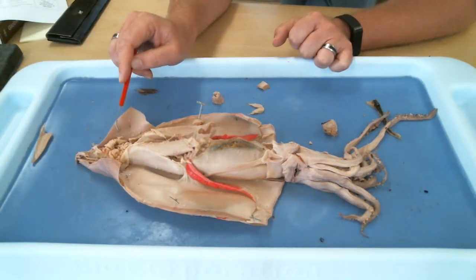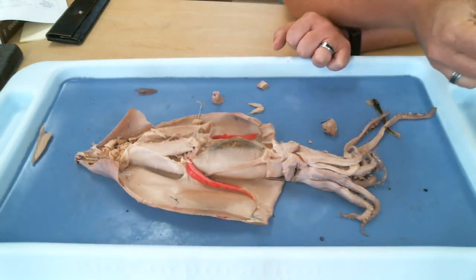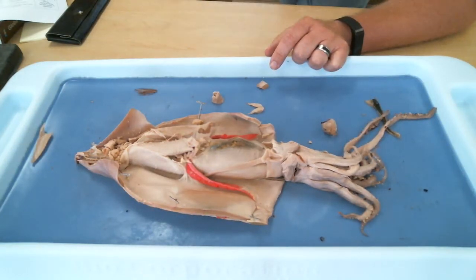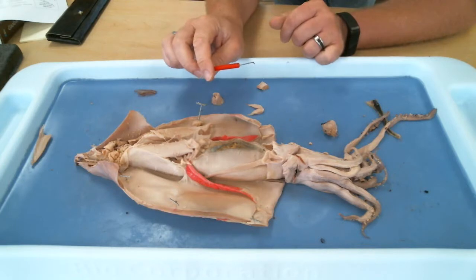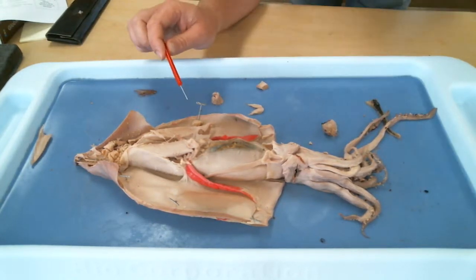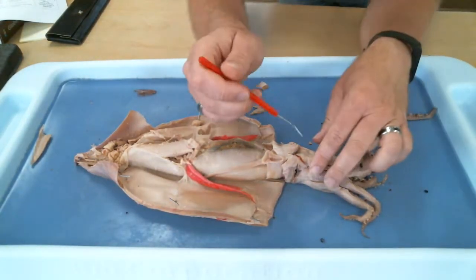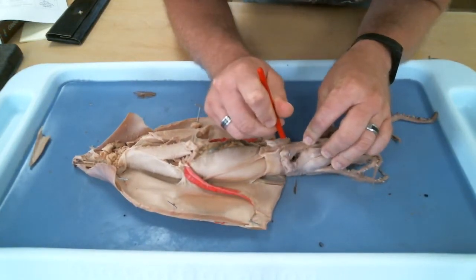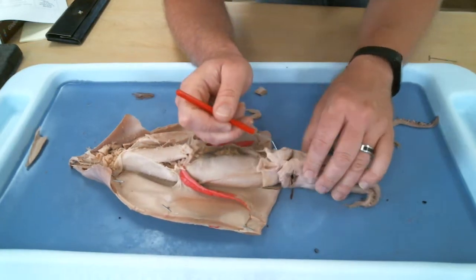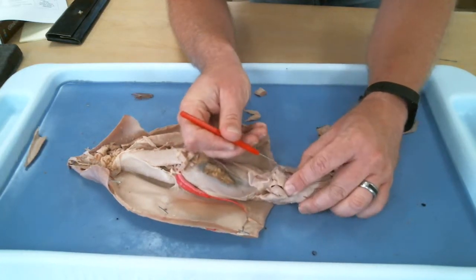They can use their fins to swim in a head first direction, but frequently you will see squid backing up into their world. If you've ever seen them swimming around, they can swim head first, but most of the time they swim tail first. I think this is the group that removed the eye. No, they didn't. So on either side, yeah, they did. I just don't know where it is. This is an eye. There would have been an eye here. Oh, the eye is still present on this side. So the eye is here.